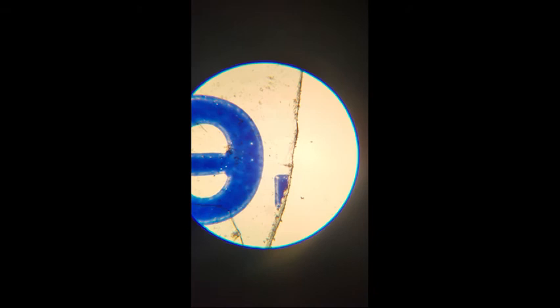Move the slide to the right. In which direction does the image appear to move under the microscope? Using the mechanical stage control, move the slide upward. In which direction does the image appear to move under the microscope?